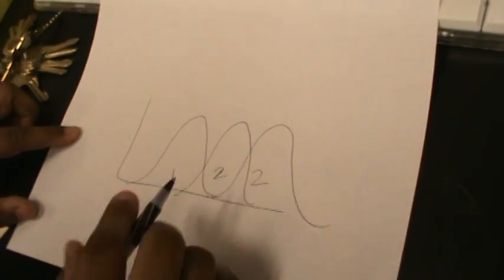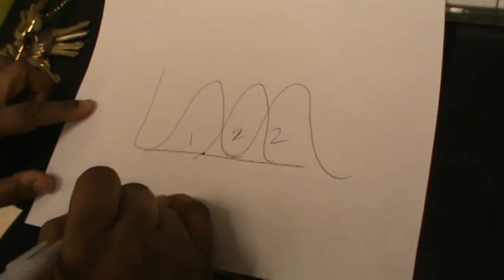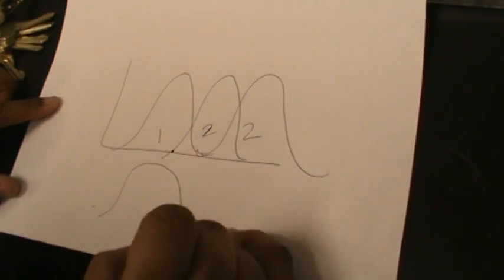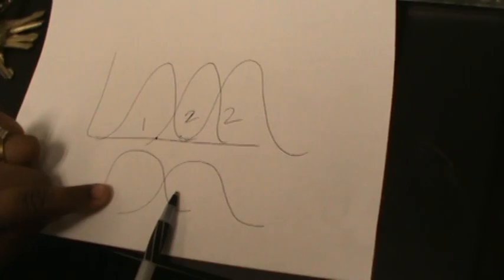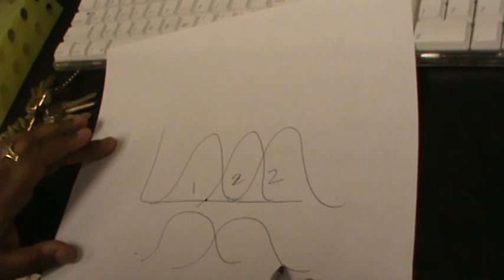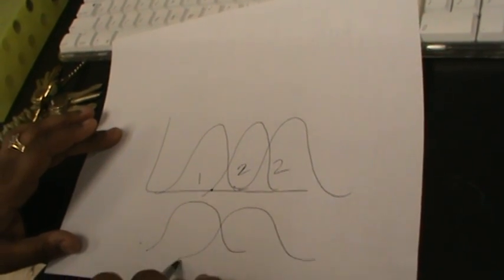This is 1 and 2. They overlap a little bit. If FITC is doing more compensation, FITC is moving more into the second channel. That's that one. If FITC is not moving more and 2 is moving more into the FITC channel, I know it's like which came first, the egg or the chicken, then it's the second channel.